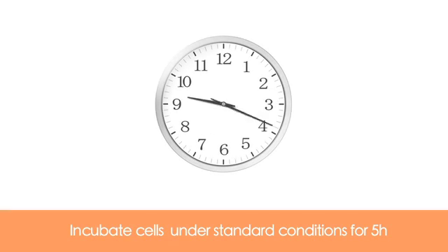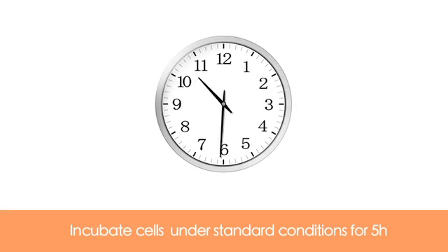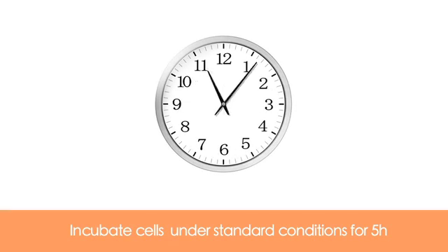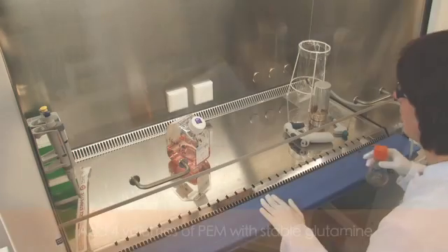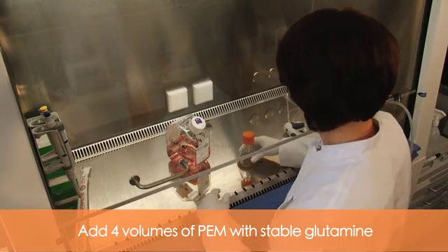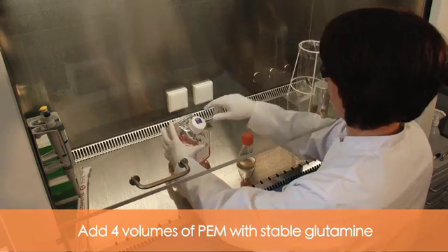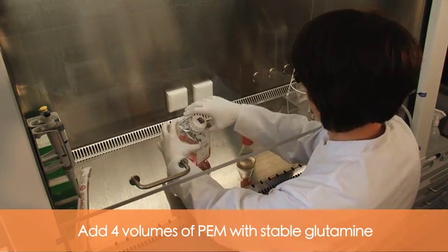Incubate the cells under standard conditions for 5 hours. Then add 4 volumes of PEM containing stable glutamine.